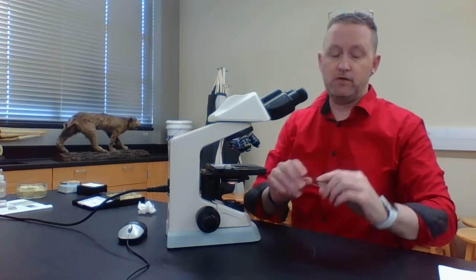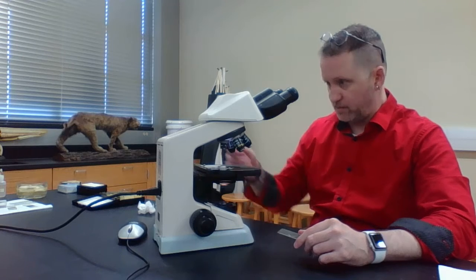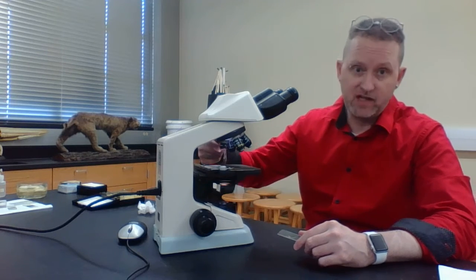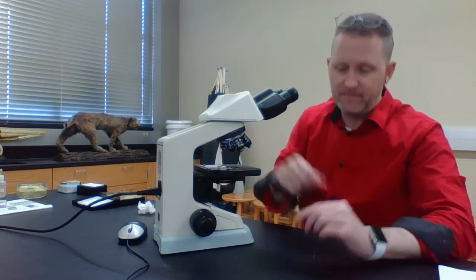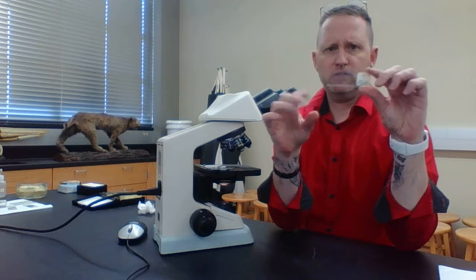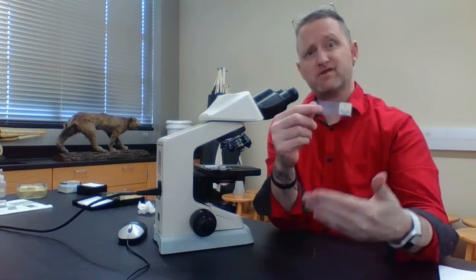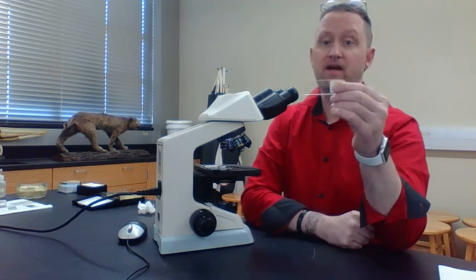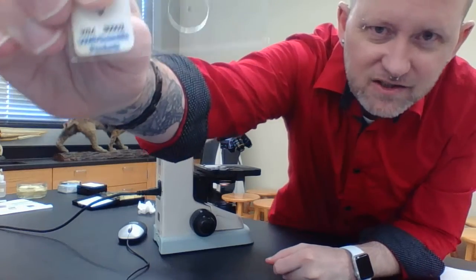And notice when you put this under your microscope, again, the stage has to be furthest away from the objective, and you want to start off under the scanning objective, which is the red objective. You're going to look at the slide like you were reading it, either off a computer screen, or something you wrote down, a magazine, or whatever. I can actually do this. I don't know if you can see it.